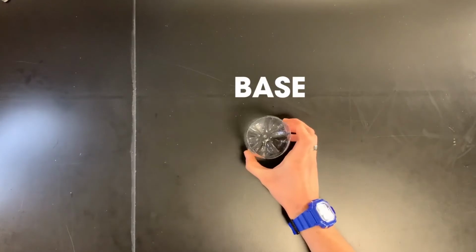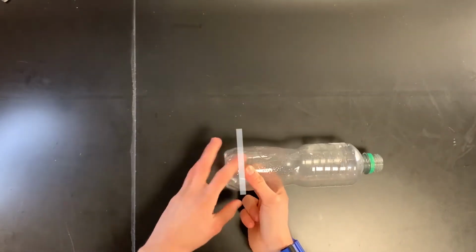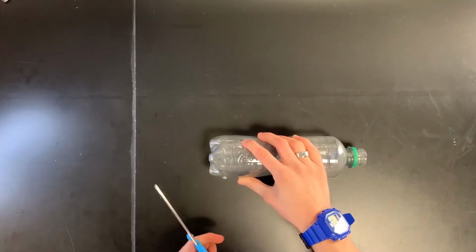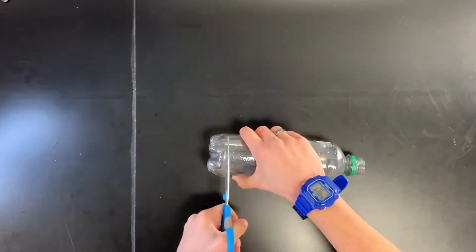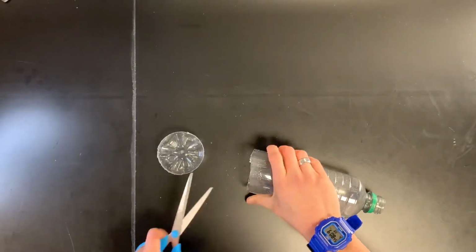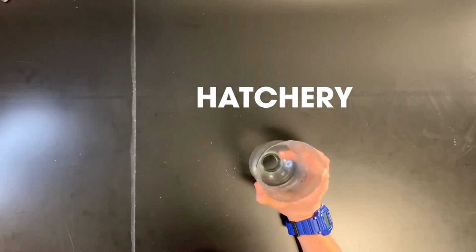This is going to be the base of our hatchery. The next thing we're going to do is take the second bottle and cut the base of it off. So to do that, we take our scissors. This is going to be the hatchery itself.